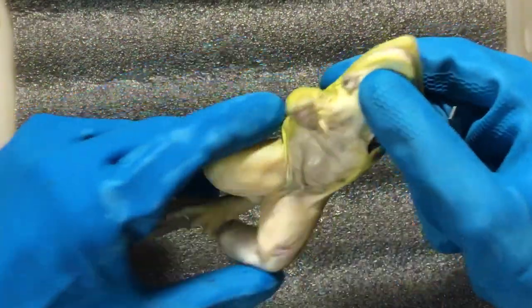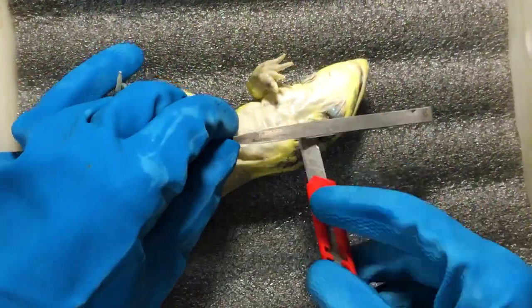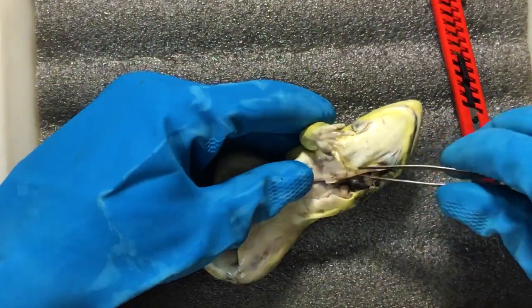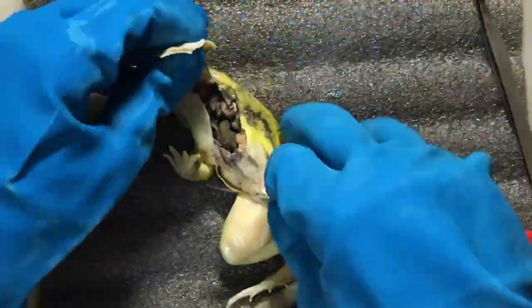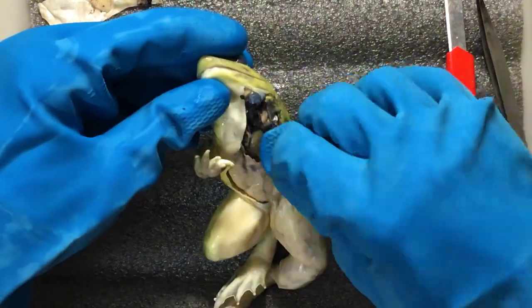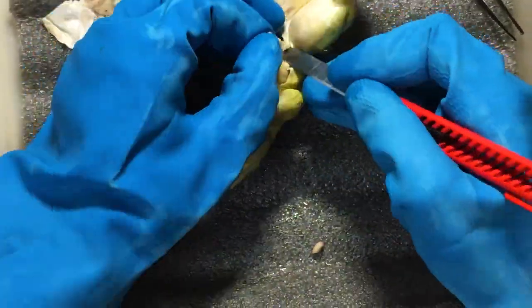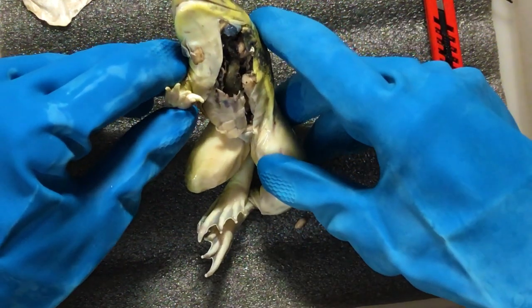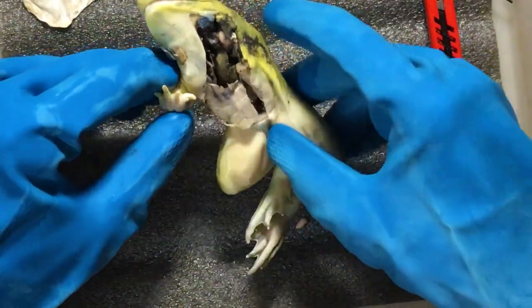Now let's start dissecting it. The dermal and epidermal layers of skin consist of squamous epithelial cells which allow various micro or electrolytic transportations.